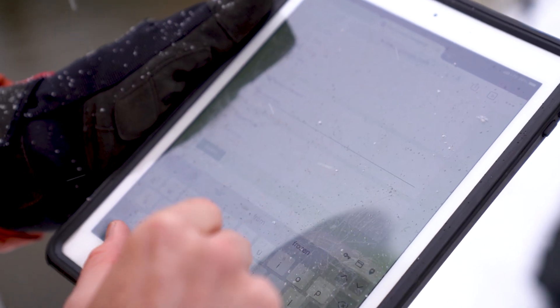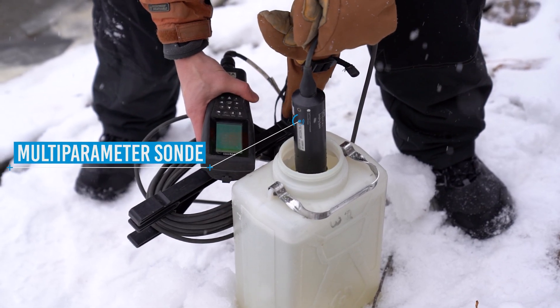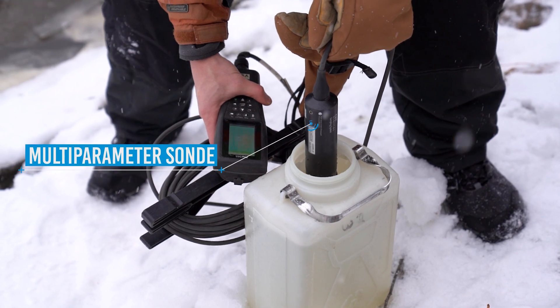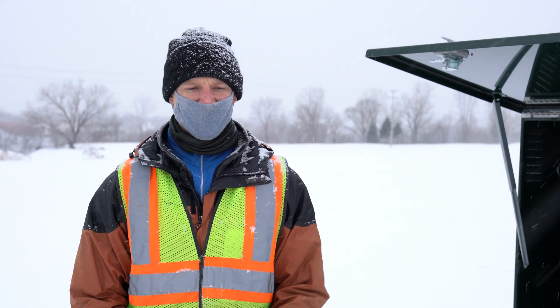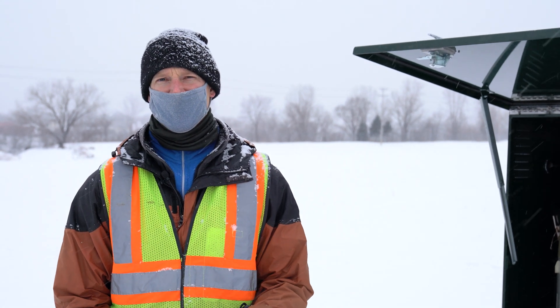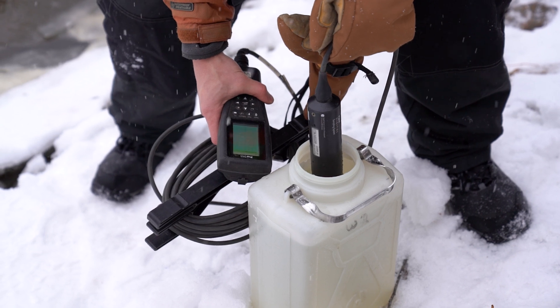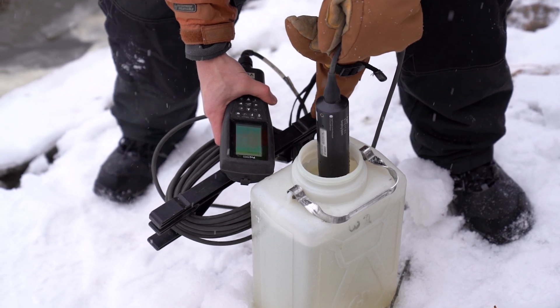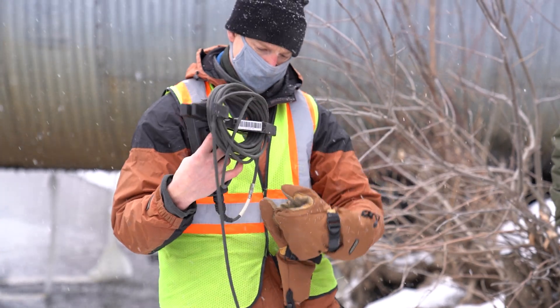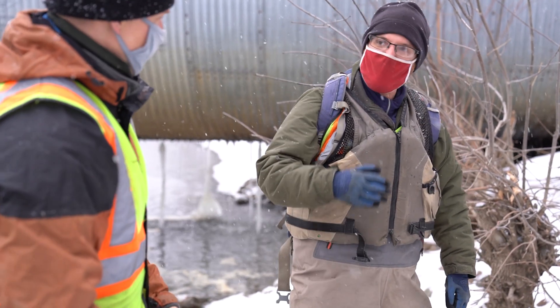Once we filled up the water bottle, we take a multi-parameter sonde, put it into our sample after rinsing the sonde, because we want to know right now what the temperature of the water is. We want to know the dissolved oxygen content. We want to know the pH, and we're also looking for conductivity. So we get those physical characteristics of the water sample right after it's collected into a bottle.